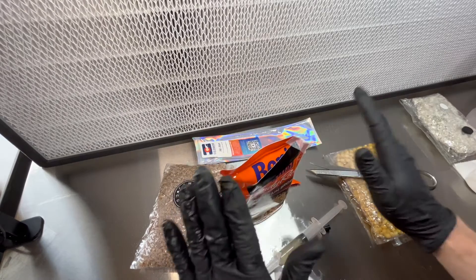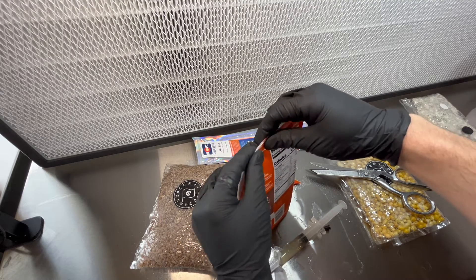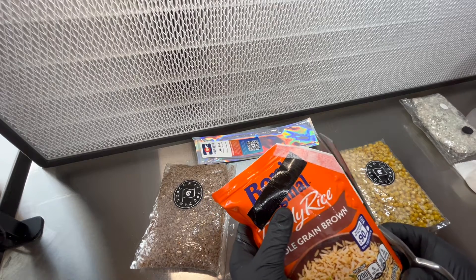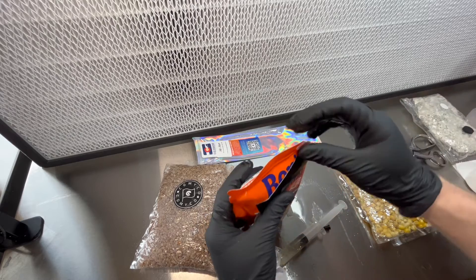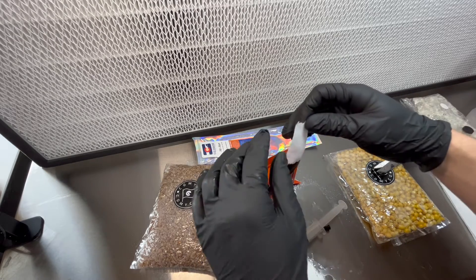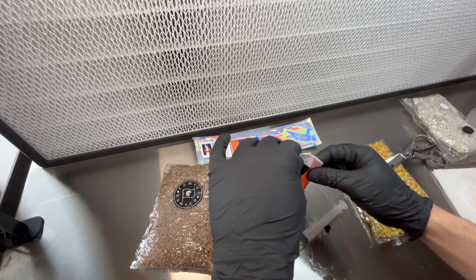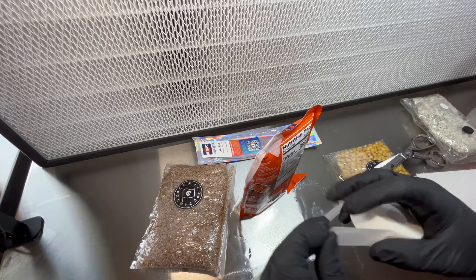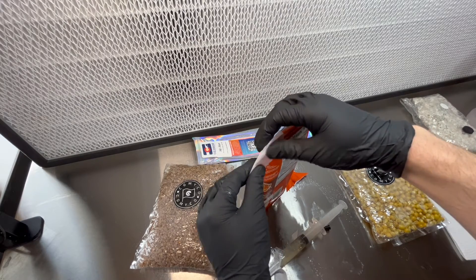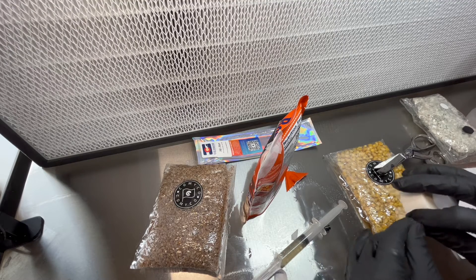It's not sticking super well because it's still wet with the isopropyl. If you're going to do this method, that's what you've got to be most careful about. This needs to be done very well. I'm going to put another piece right up there because — man, this method sketches me out. I'm probably not doing the best job possible here, but you've got to be prepared to fail with this method. It's a bit precarious. But that's the gist of it — this is how you do it. I'm sure a lot of you are very familiar with this method. It's sterile grain. Hopefully nothing fell in there for the few seconds it was open, and I'm just taping the ever-loving crap out of it, hoping that nothing gets in there.